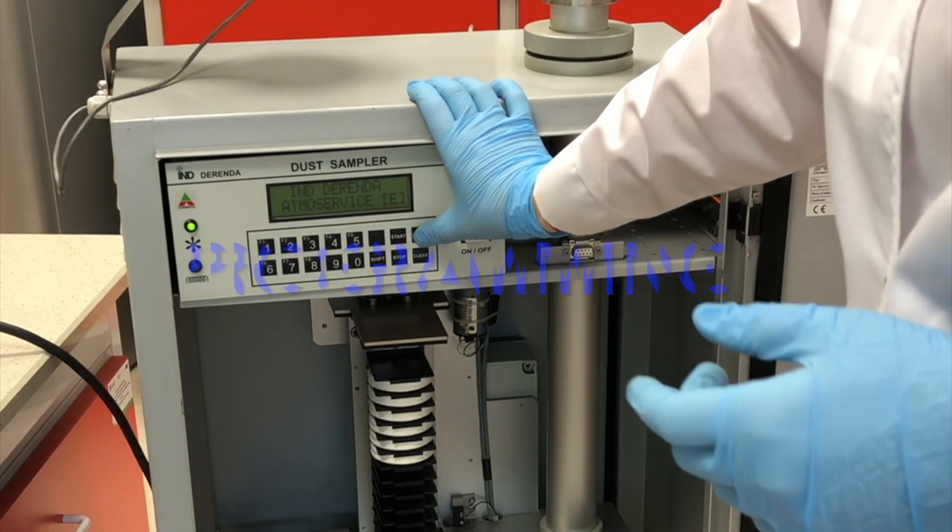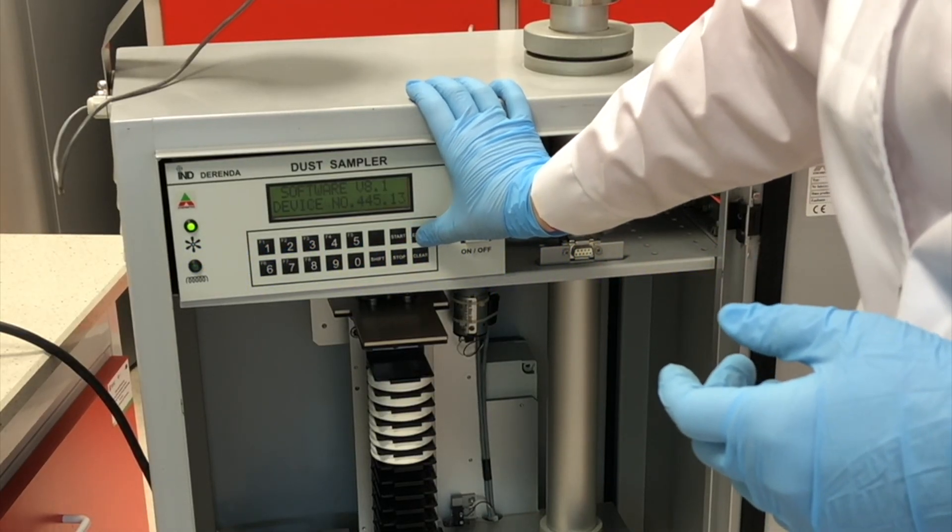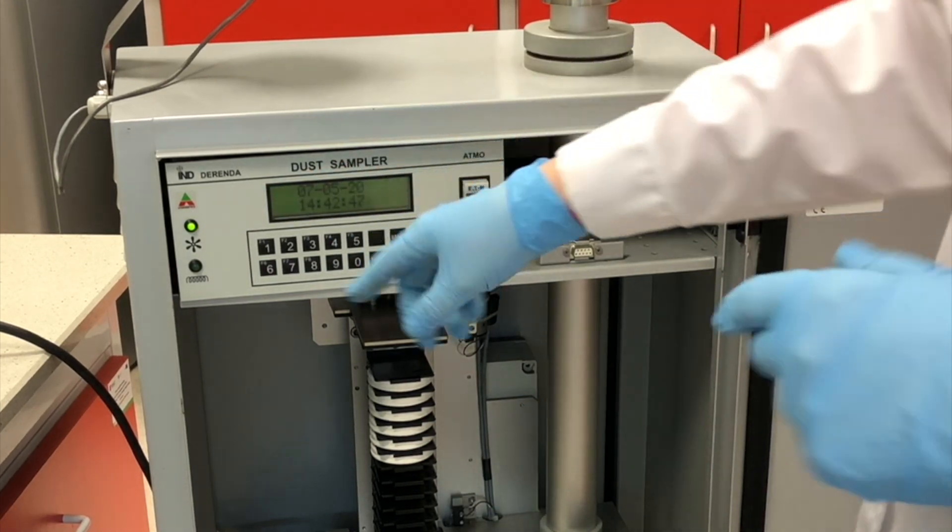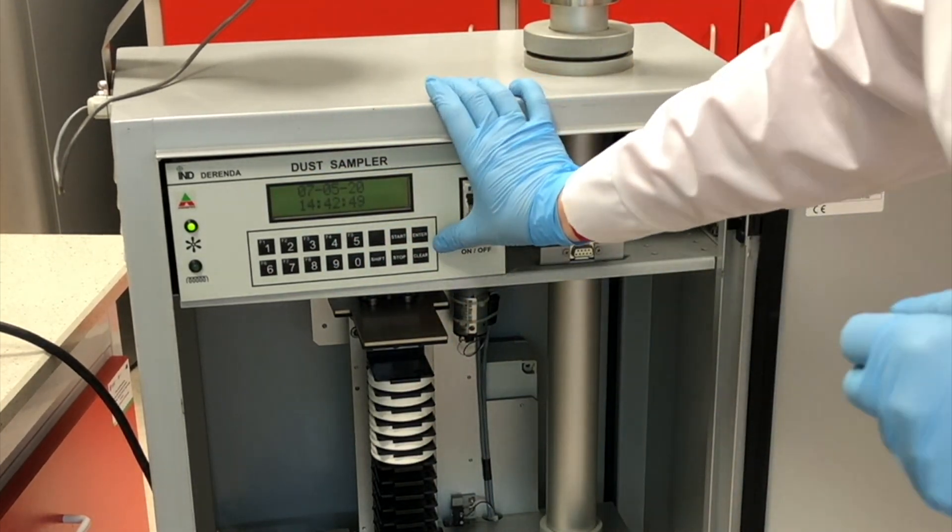First we look at if there is a proper date. Today is the 7th of May. The hour is also correct.